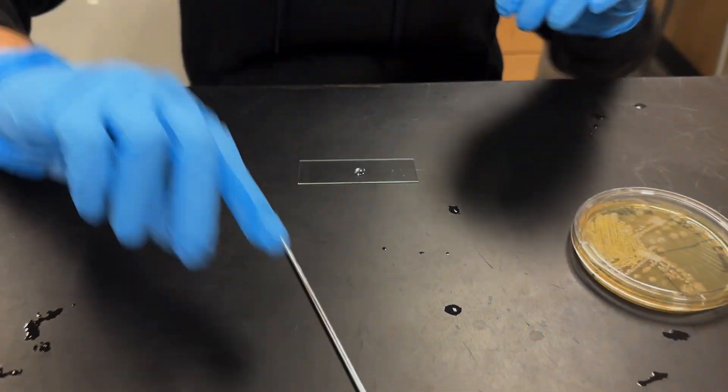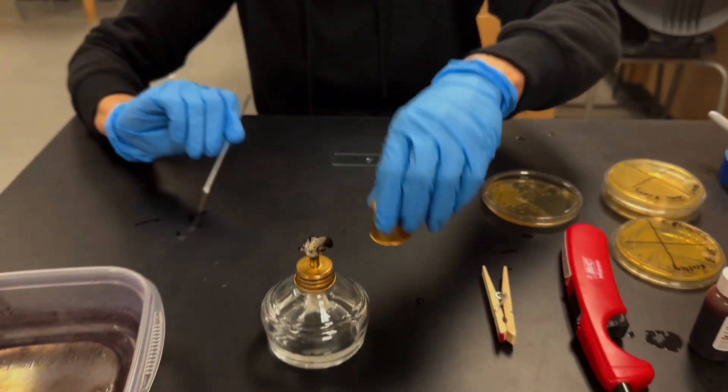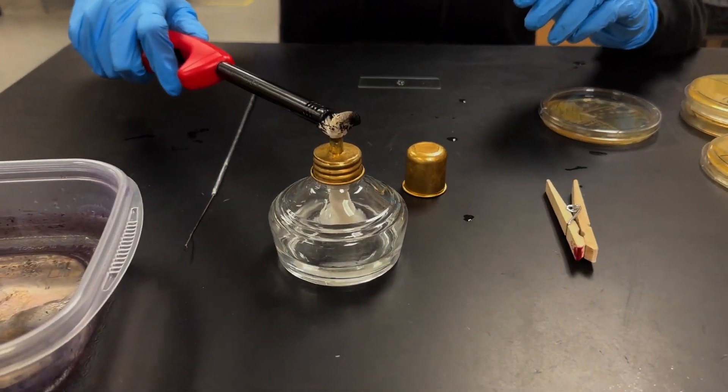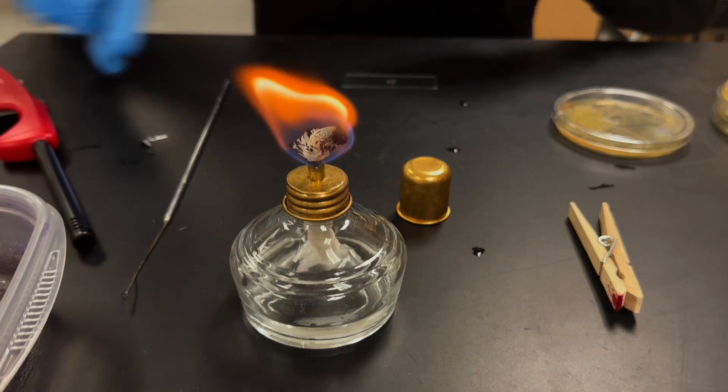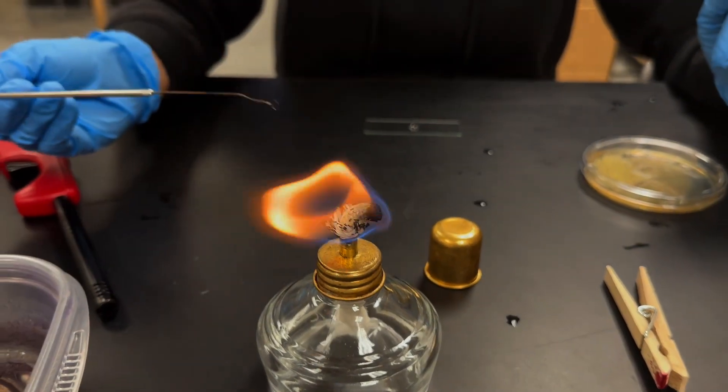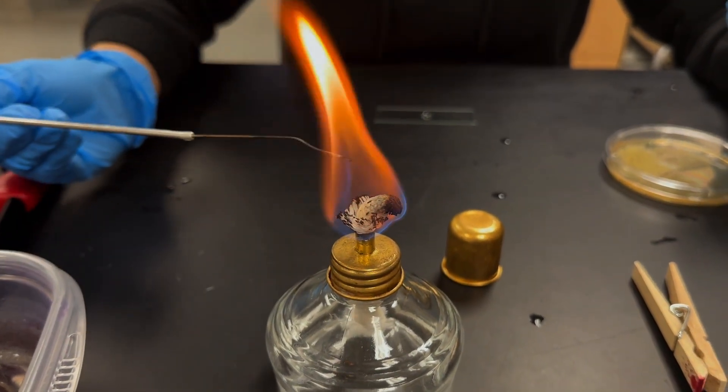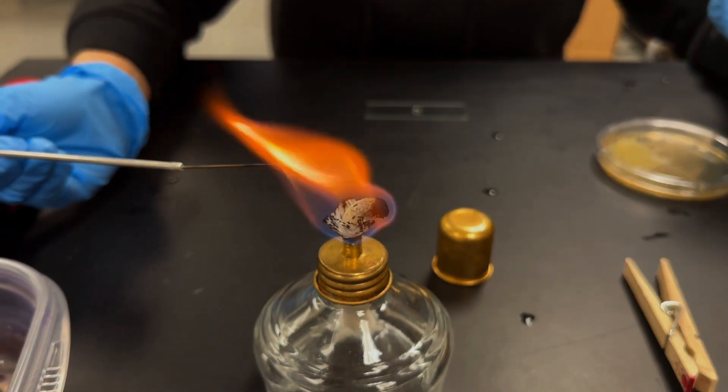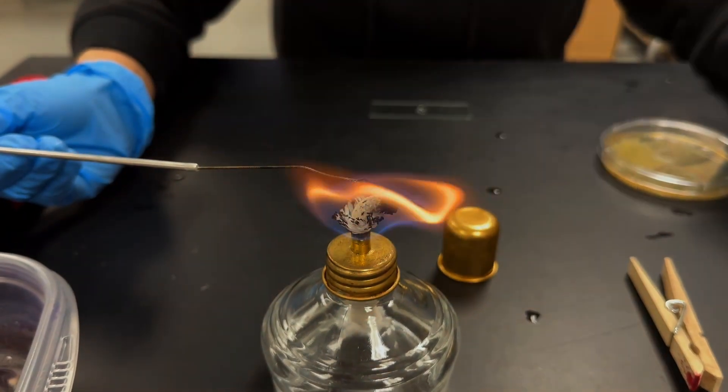And once you have your water there, you're going to go ahead and light your burner. Make sure it's clear of things and there's no paper nearby. You'll also want to make sure all of your stains are away from the flame as well.